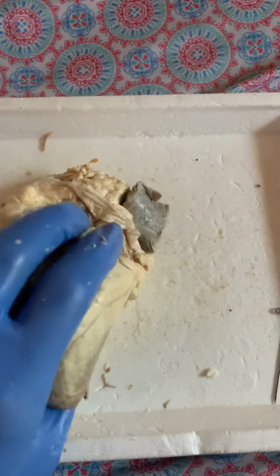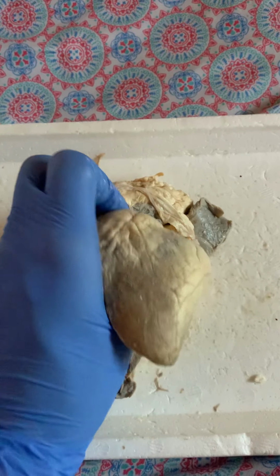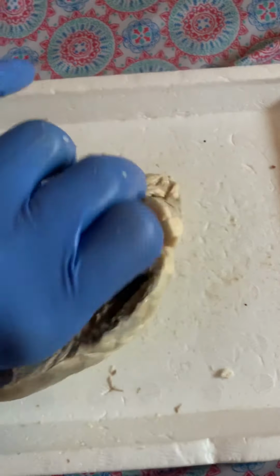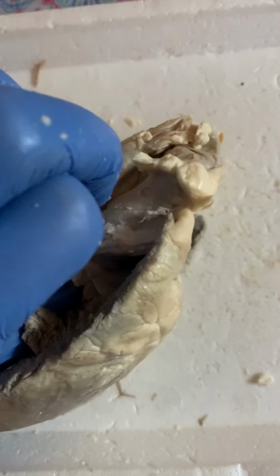And then the blood from the left ventricle gets pumped to the systemic circulation via the aorta, and that's a pretty thick vessel. I have my thumb in there right now. It's right here. I don't know if you can tell, my thumb is right there. I'm moving it. And it's really, really thick compared to the pulmonary trunk.